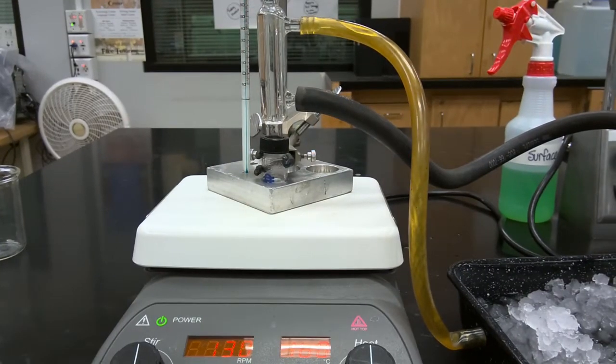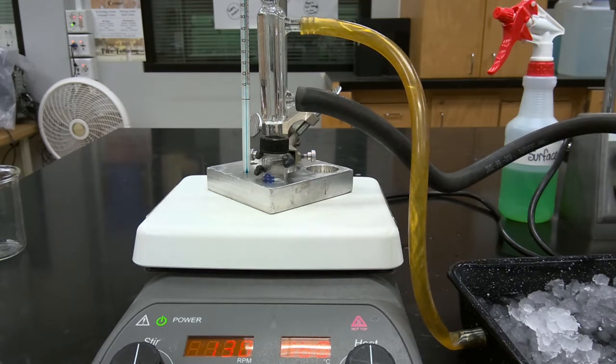So after a little bit of waiting, we've reached the target temperature for our bath temperature of 120 degrees Celsius. So we're then going to heat our reaction mixture to allow this transesterification reaction to proceed. We're going to heat this reaction mixture for 1 hour at a gentle reflux. So we'll resume once we've finished heating this reaction mixture for the required 1 hour reaction time.